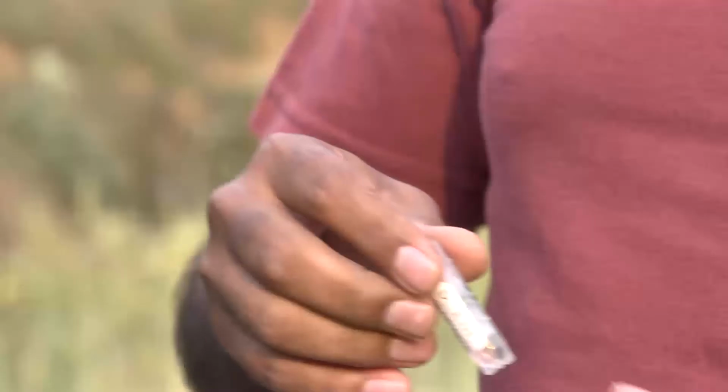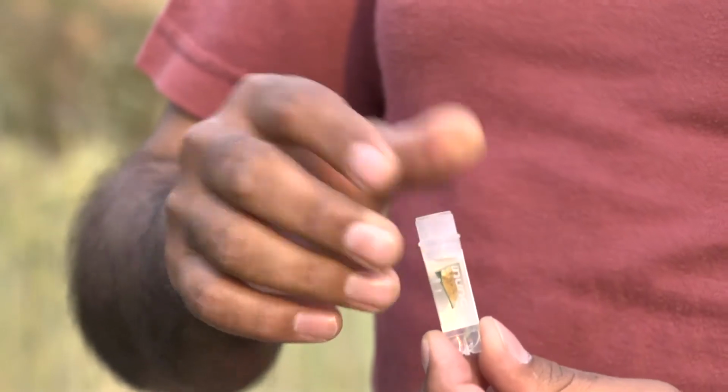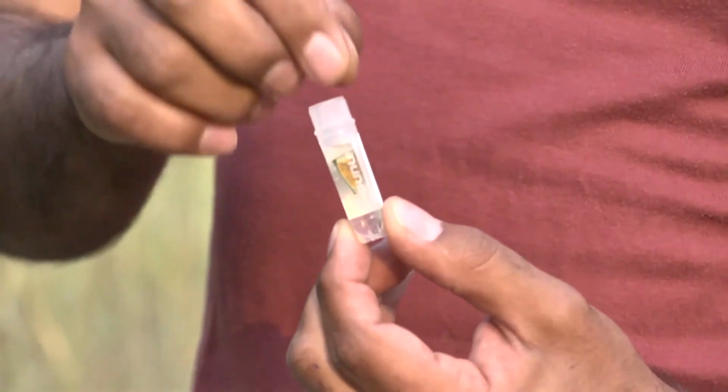Then we will extract the DNA, and with molecular markers and sequencing techniques we can tell which species and formae speciales was on this sample. So when sending the sample from this region to any international lab, or even within the region to another lab, it's better to have this alcohol technique, because this will kill the pathogen and it will not go outside the lab in those countries and infect the wheat crop. So that's why we put ethanol alcohol here, and that will avoid any contamination.